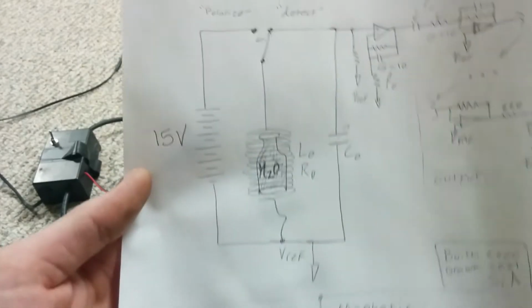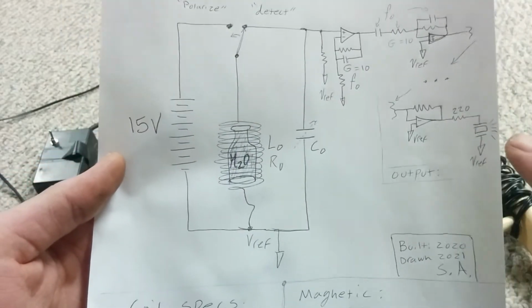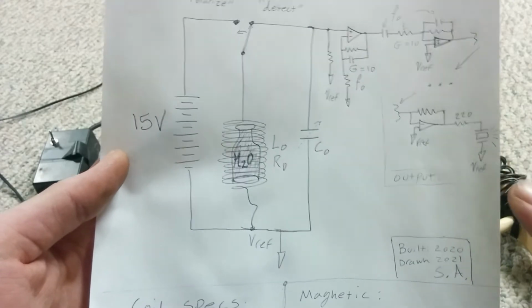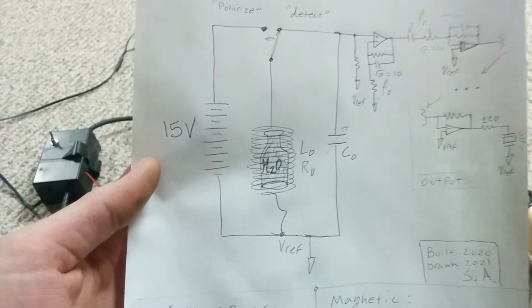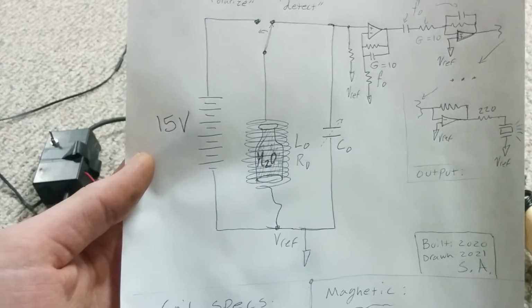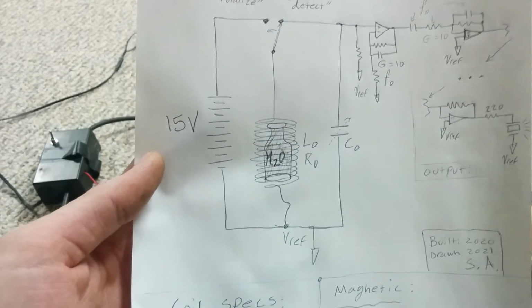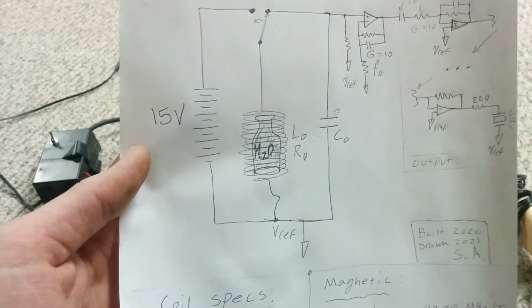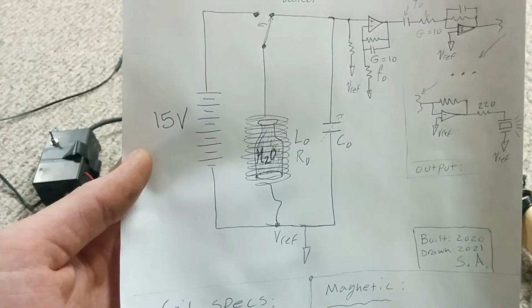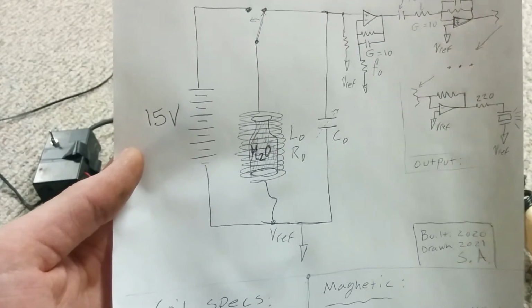And what else? So on the transducer front, I found a piezo with the lowest resonance. Its main resonance is at exactly the frequency of interest. I think they're rated as 2.2. I bought them on DigiKey. Maybe they're just 2 kilohertz, but there's quite a variance. So I binned them and picked one out that was exactly perfect for the task at hand.